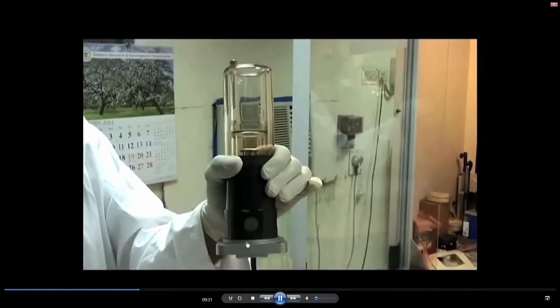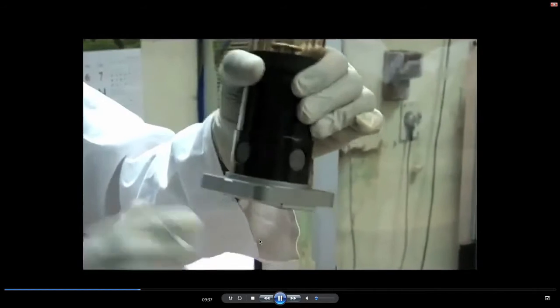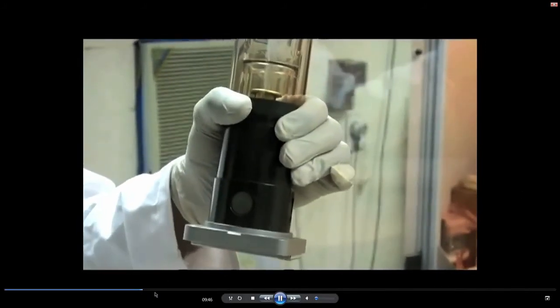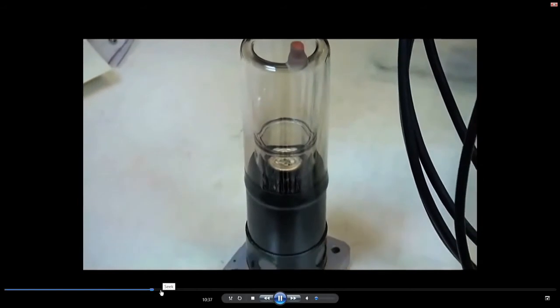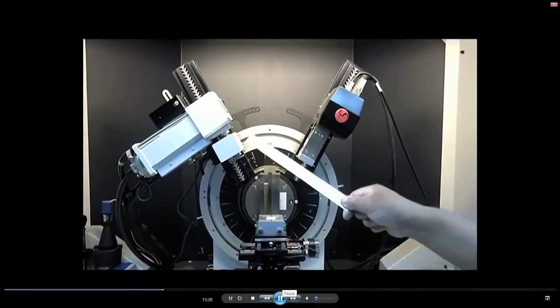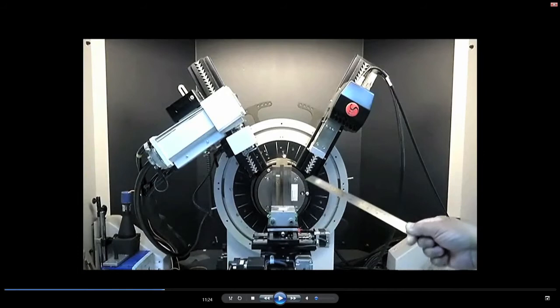Of course, the whole tube is under the cooling system, and you have the beryllium windows through which your X-ray comes out. Beryllium windows are transparent to X-rays. That detail I would like to finish. So, have a close look at this X-ray tube. Now we will move on to an experiment. Before we go to the experiment, let me stop here and explain a little more about this.